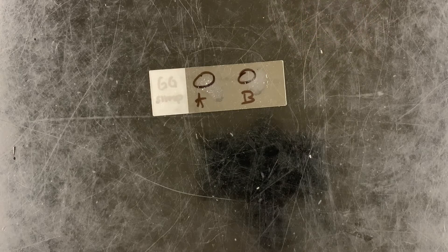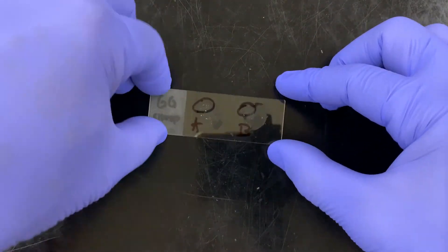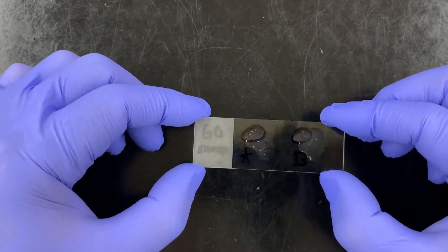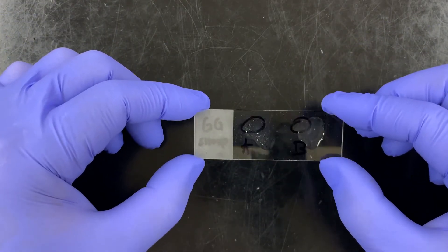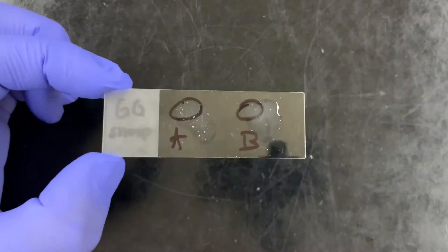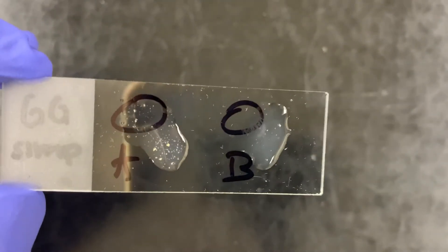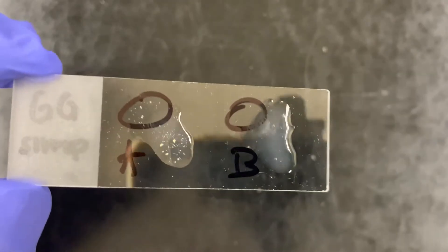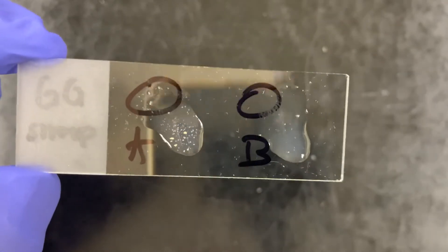Give it a little moment, a little bit of back and forth, and you can already start to see the reaction. I'm going to bring it a little bit closer to the camera. One is obviously coagulating, and the other one is remaining still kind of cloudy.